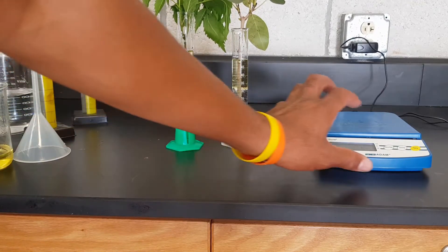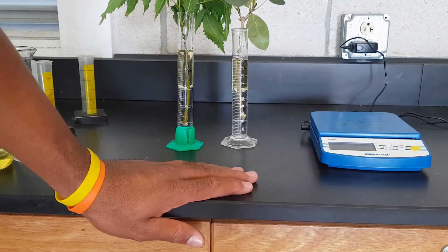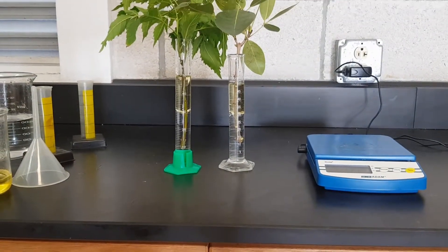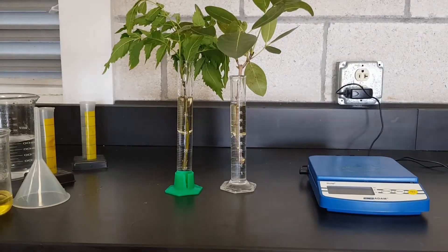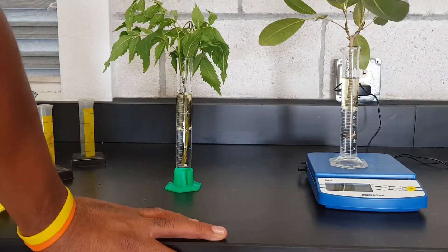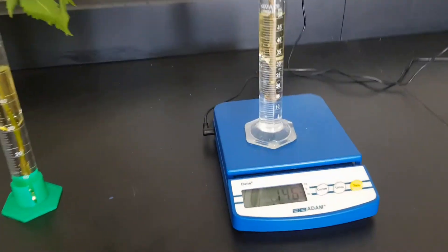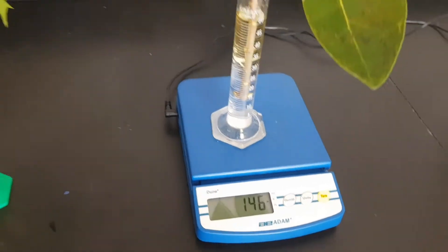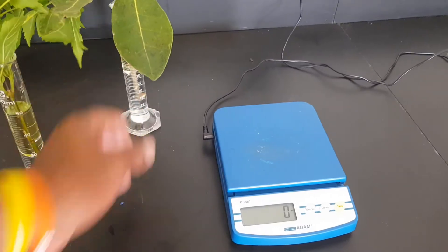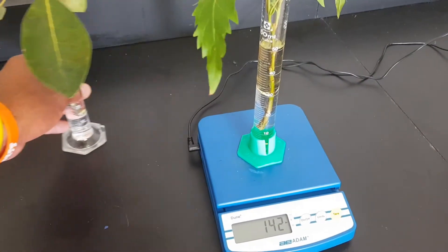Our next step is to get the mass — you want to check the mass of each apparatus. Our first one measures 146, so that's plant one. We then measure the second plant, and this one is 142.